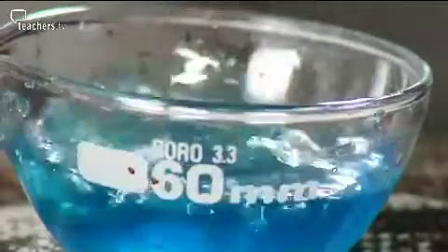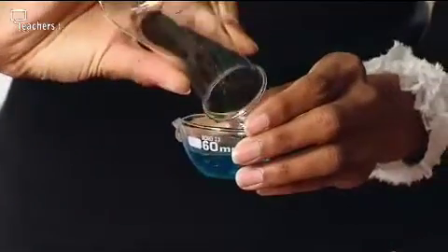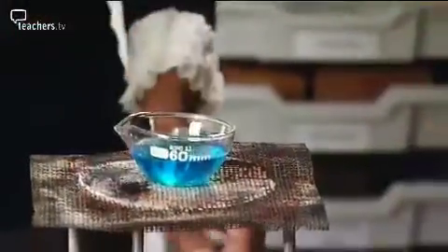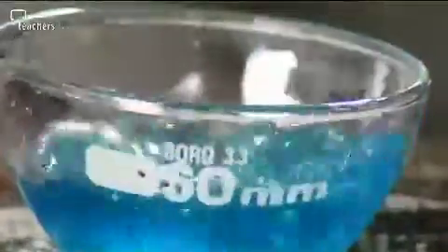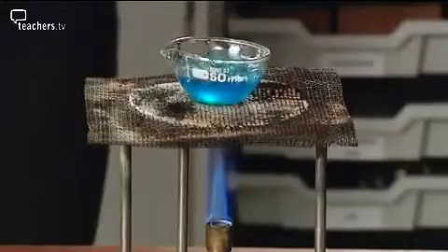Stage 3. The evaporation phase also has its problems. So what shall I do with that then? Now pour that into the evaporating basin and place it on the gauze. The instructions usually say that you should boil away half of the liquid. This evaporating basin won't do the job. Oh dear. We've got a very small evaporating basin for the process. We should have used a bigger one.